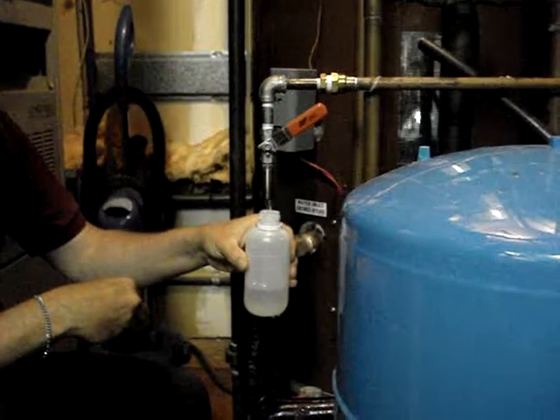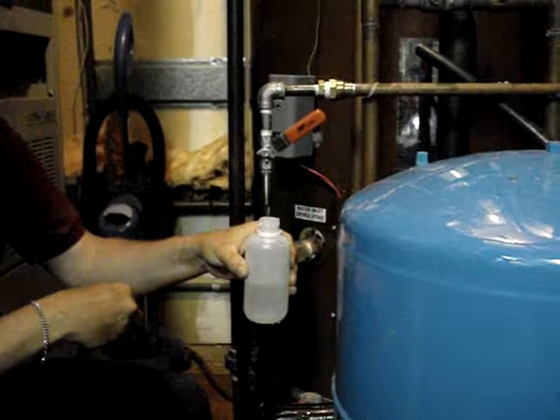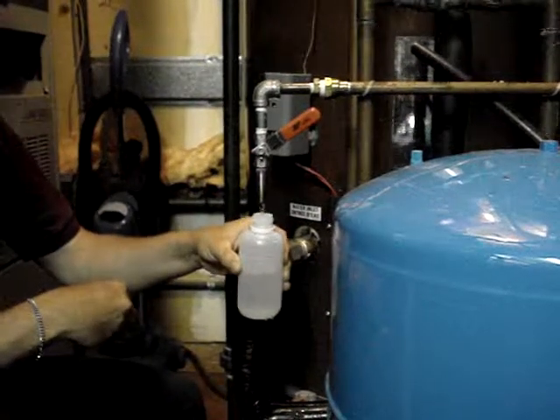This spout's actually made of stainless steel, it's got no threads on it. It's a stainless steel nipple cut in half and then deburred, threaded into a quarter inch valve.